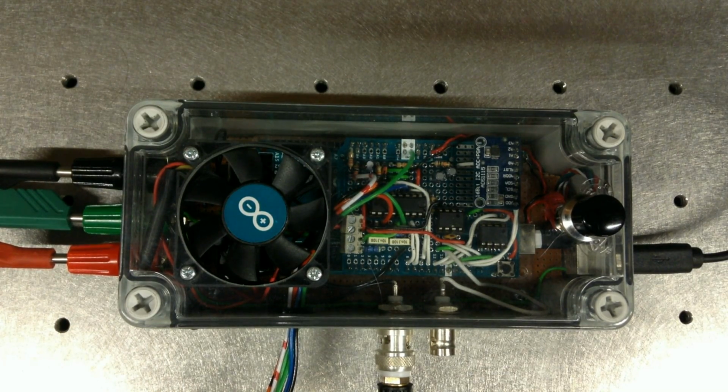So this is the project box that controls the monochromator. Inside the box is an Arduino Mega, and on top of that is a prototyping board. Mounted on the prototyping board is the controlling IC chip for the stepper motor, which is the L293DNE. Beside that over here is the transimpedance amplifier, which converts the output signal from the SiPM to a voltage.